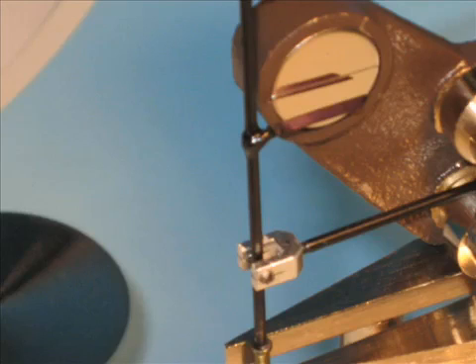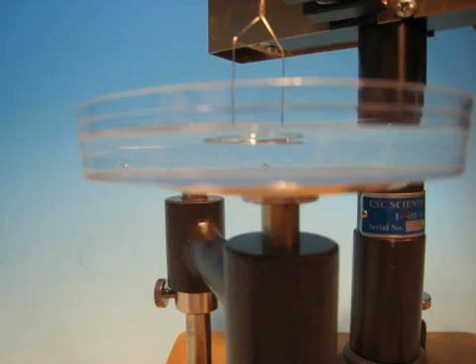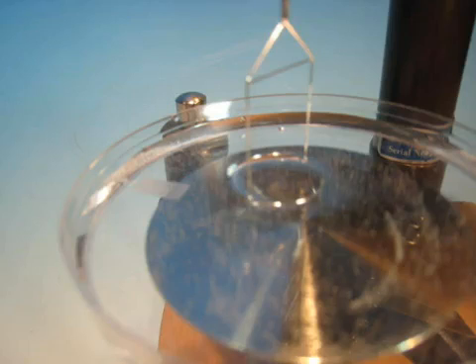With the ring below the surface of the sample, begin to lower the sample table with the sample table adjusting screw. When the ring approaches the surface, the pointer will move below the mirror line.